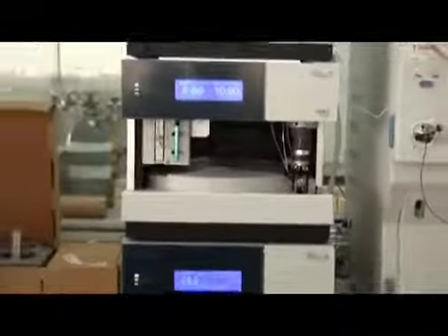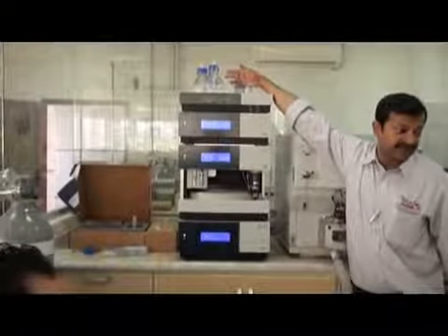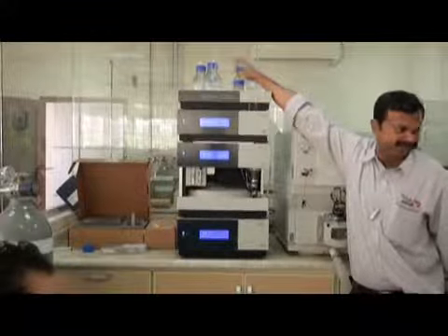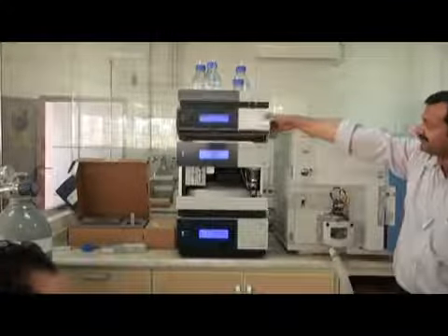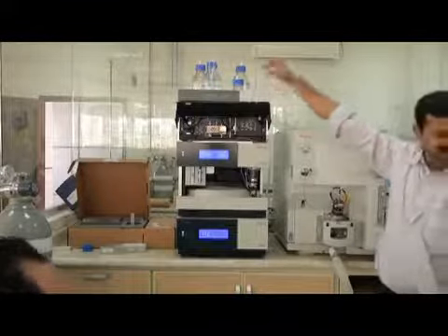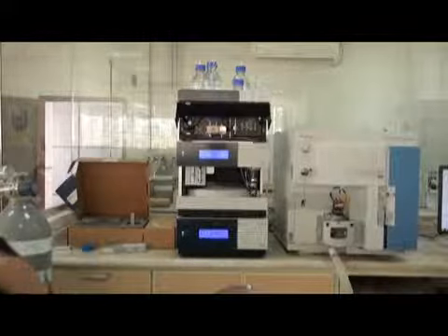Sometimes it happens that your pump rinsing solution, this small bottle, is empty. You did not notice and it becomes empty. So now this line is empty. Now you need to fill it. You put a new solvent, but this line is not filled. Okay? You have to fill it. So what to do in this case? Just put a new solution here. Okay? And then come to the pump.